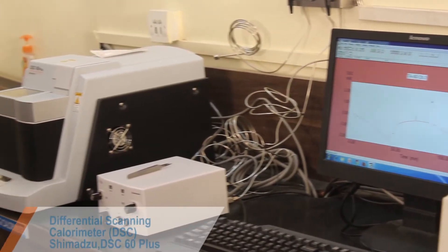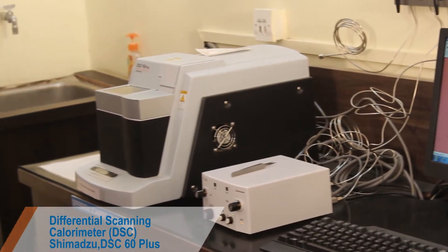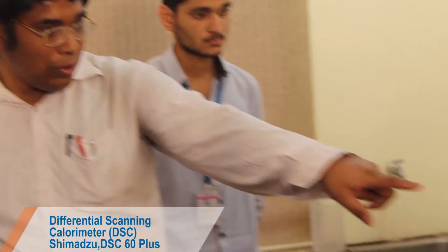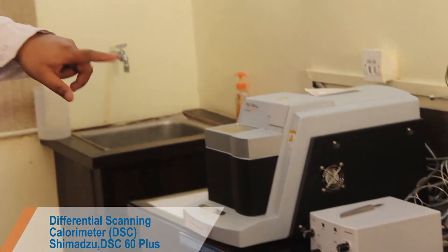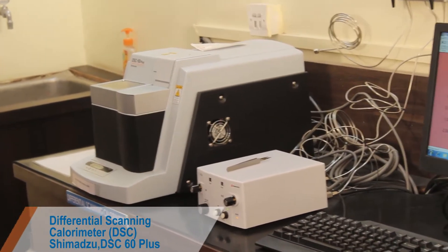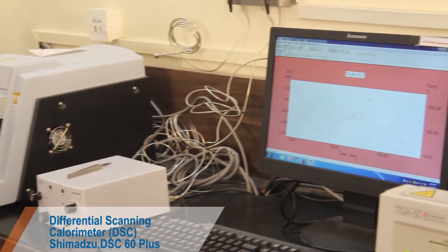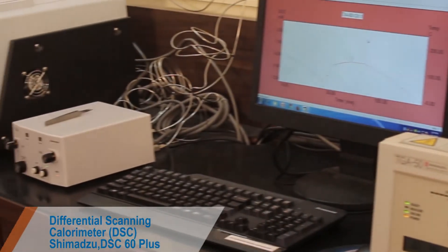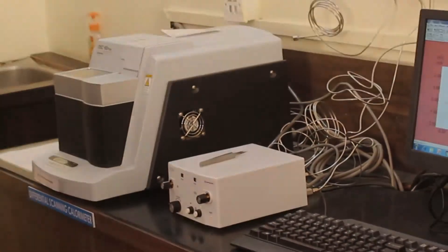DSC can be used to measure a number of characteristic properties of a sample. Using this technique, it is possible to observe fusion and crystallization events as well as glass transition temperatures. DSC can also be used to study drug-excipient compatibility studies and studying polymorphism, etc.